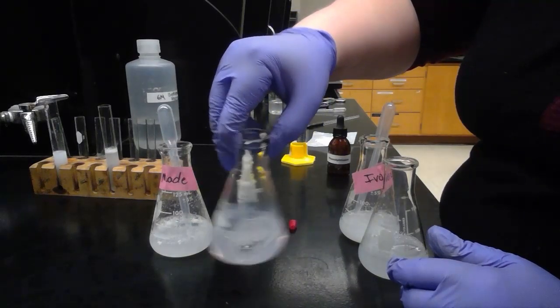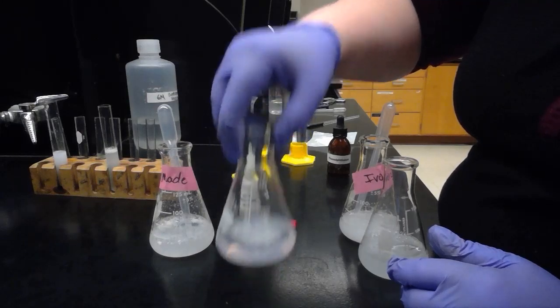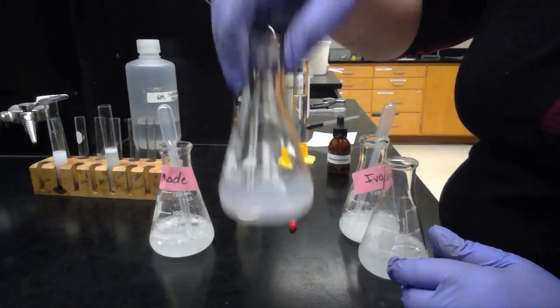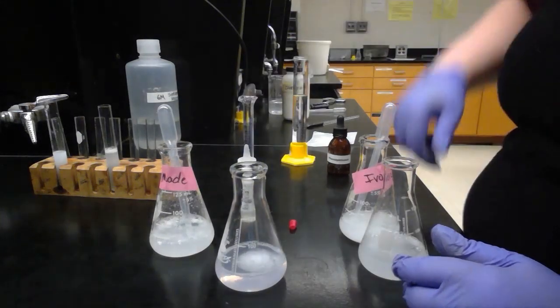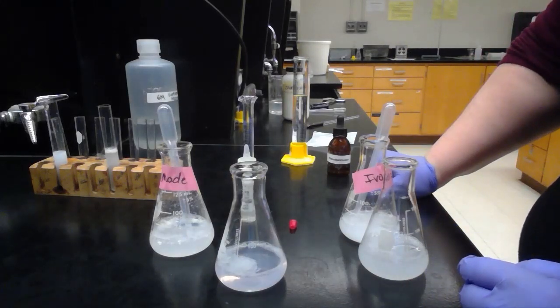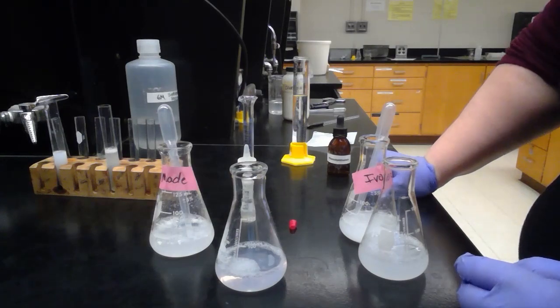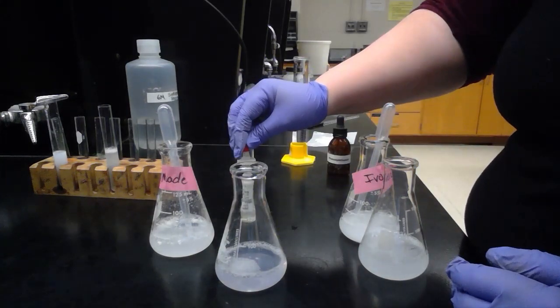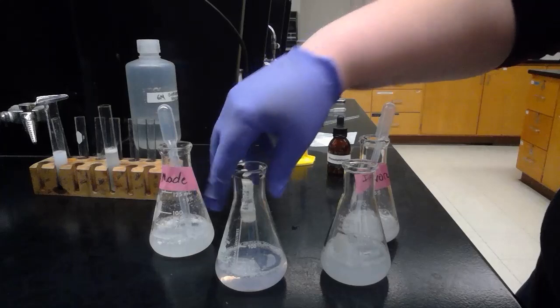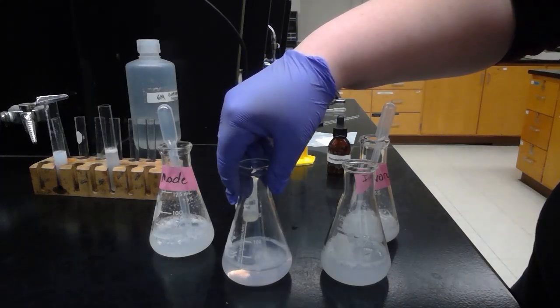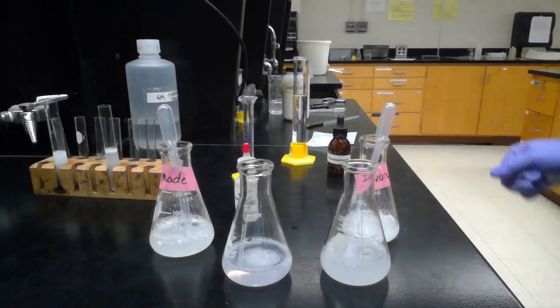Swirl that. And it's gone clear. Let's see if it stays clear or if it goes back to pink. Yep, that looks good to me. Now we've got them both as clear and so we no longer have that alkalinity. Now it is neutralized.